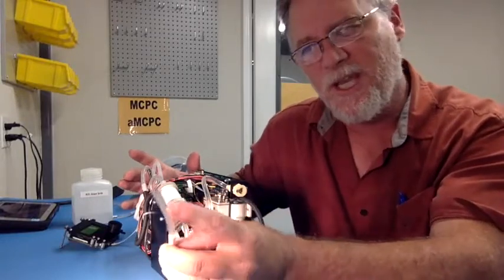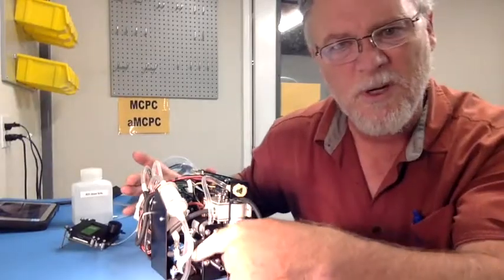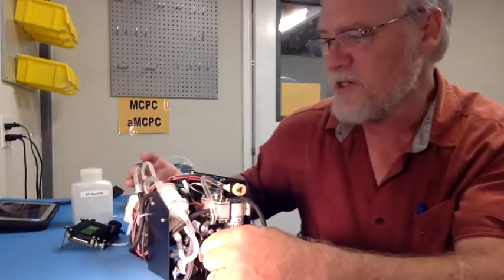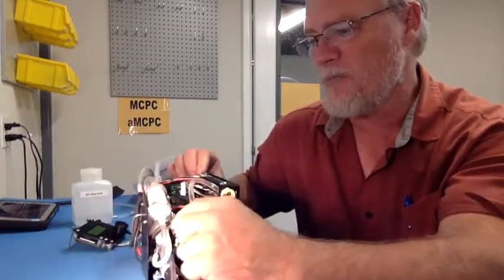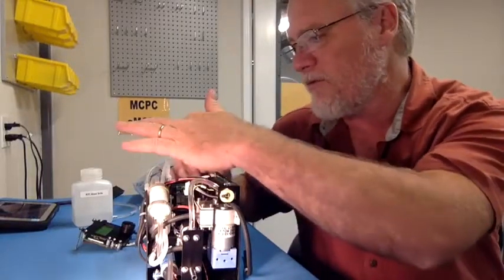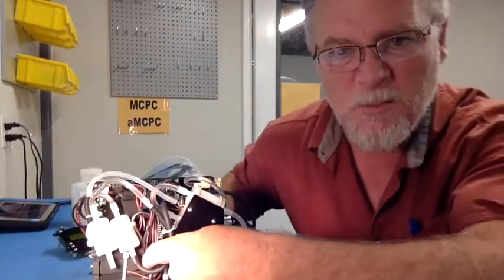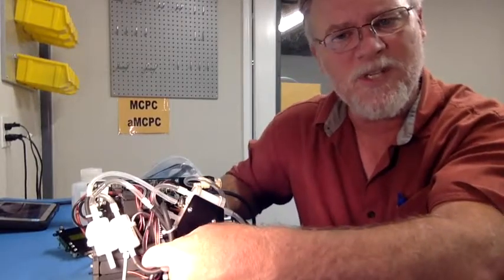This is actually the inlet for the saturator pump. There's a very small saturator pump right in the front here that's drawing in air, and it's acting like a little compressor. It's pumping the air through these filters, and then that flow is measured in a laminar flow element, which is this metal assembly with the red and black tube right here, before it flows into the saturator. The saturator is this box in the bottom here that's kept warm at 45 degrees C.